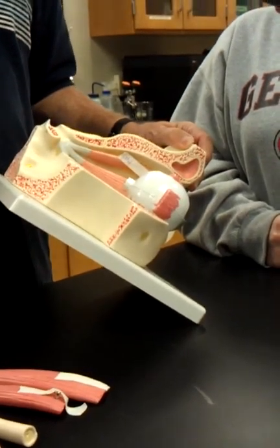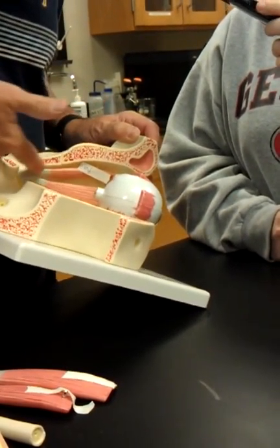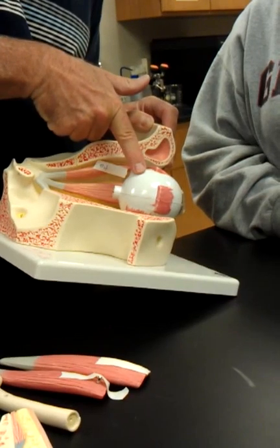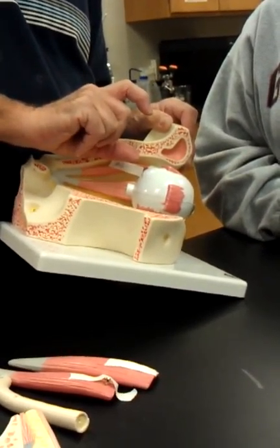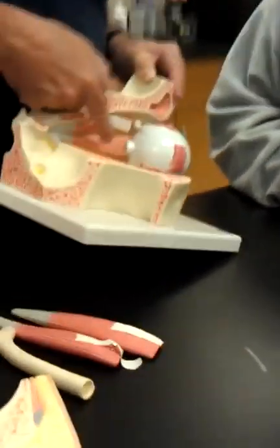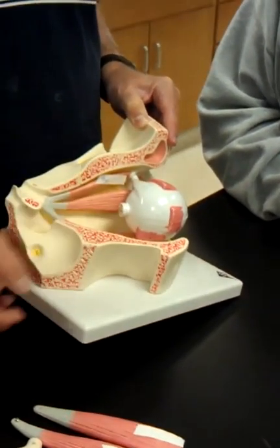So the oblique that's pretty easy to point to and see would be the superior oblique. So it's coming across here. There's actually a little loop of connective tissue, and its tendon goes through the loop and then attaches like this across the sclera. So when it contracts, it rotates the eyeball like that. Okay, then this one, because it's really small and kind of tough to see, so you've got to look in there, but that would be the inferior oblique. And when it contracts, it rotates this way. Well, I want you to get it on your own.